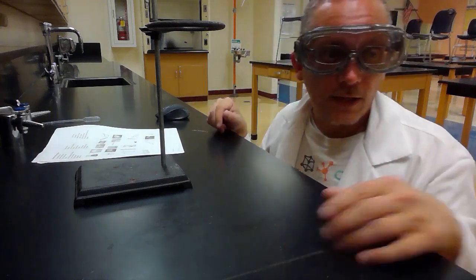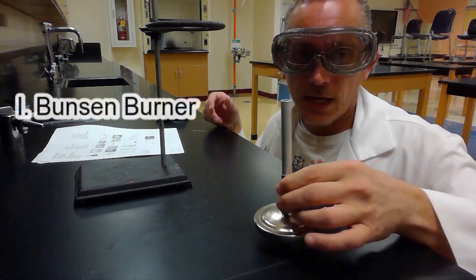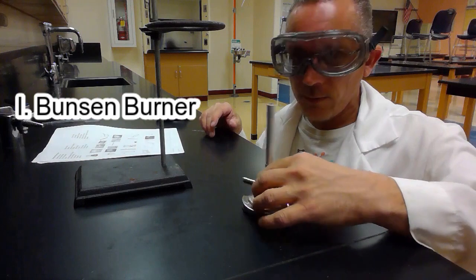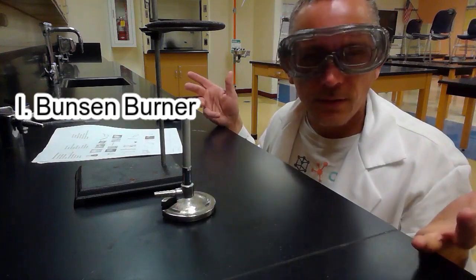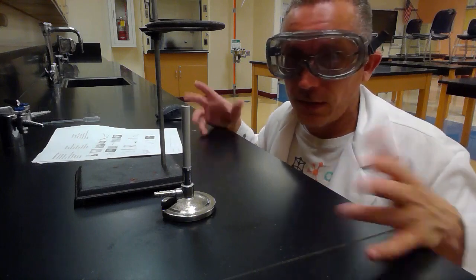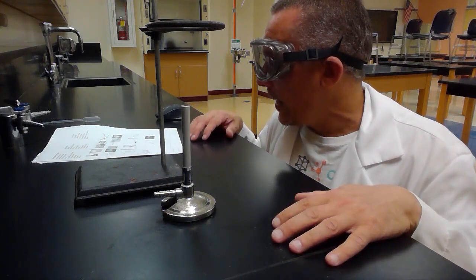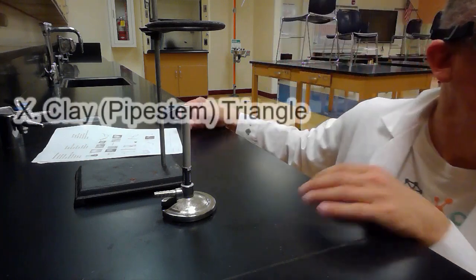And underneath my ring clamp, I'm going to put picture I. Picture I is a Bunsen burner. We saw a Bunsen burner in the last video. I'm not going to put the hose on it, I'm just going to put the Bunsen burner here. And what's a Bunsen burner used for? It's used for heating some stuff where we might need fire. Okay. And I'm going to put onto that picture X.